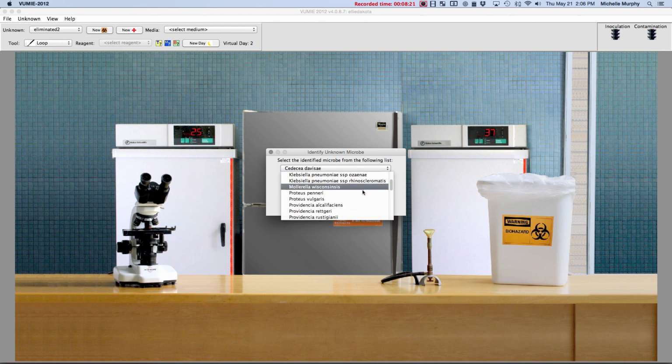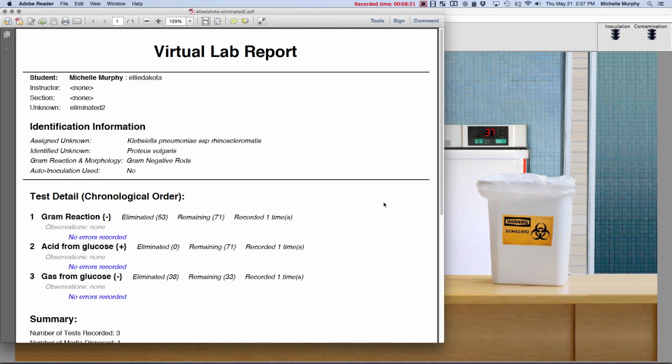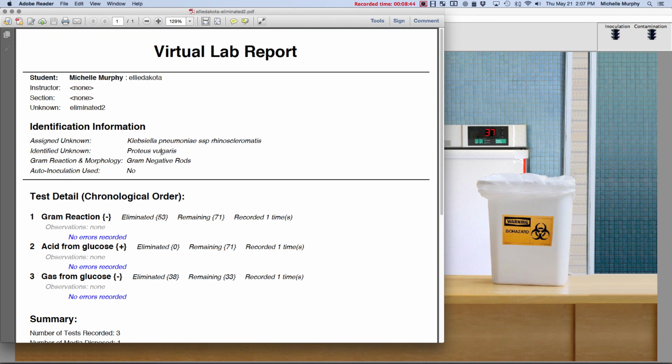By the time you get to about lab 10, then you'll be expected to know how to do this, but not lab 1 and 2. We're just learning the process. All right, yes, I was not correct. I'm going to look at my lab report, and here you see I don't have those guess errors. It says no errors recorded, no errors recorded, no errors recorded. I did everything right. I'm going to get all my points because we're not worried about the name of the unknown yet, not till lab 10, because I did everything the directions said and I had no errors.